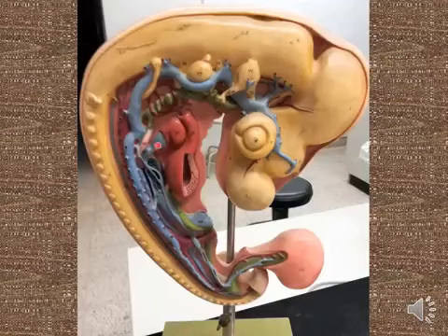lateral to the vitelline vein. Again, sinus venosus, common cardinal vein, divided anterior cardinal vein, posterior cardinal vein, and from the sinus venosus, vitelline vein and umbilical vein. And this is the dorsal aorta. You can see dorsal aorta, anteriorly bilateral dorsal aorta, while caudally fused, forming the single dorsal aorta.